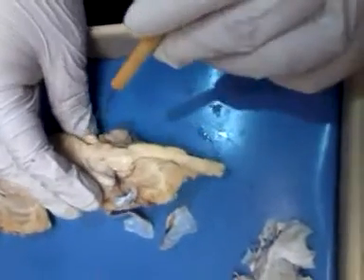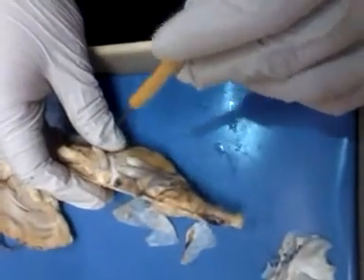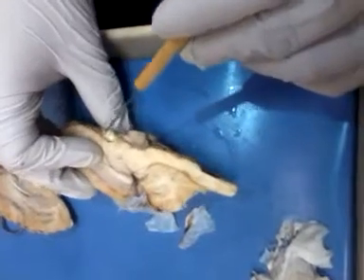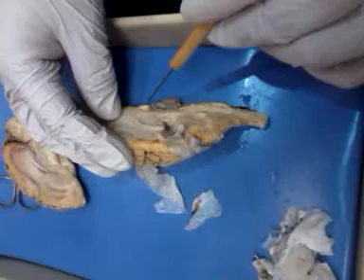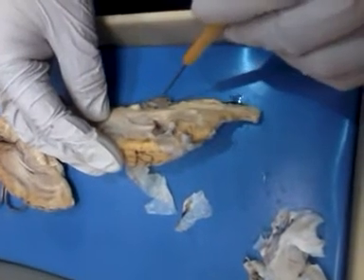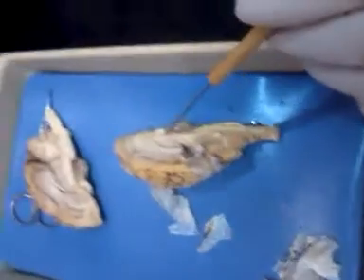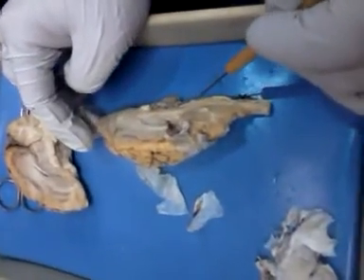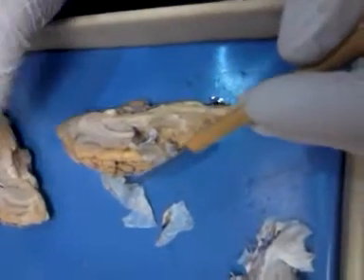Okay? If it's in here, that's your optic chiasma, because that's where this is cut in half. Where they crossed. Okay? This would be optic chiasma. This is your pituitary gland. So if it kind of goes back, it's optic chiasma, pituitary gland, pons. Like you'll see in all the models, the pons looks like it's huge and bulged out, but really on these, it's really not so much. So it's midbrain, pons, medulla oblongata.